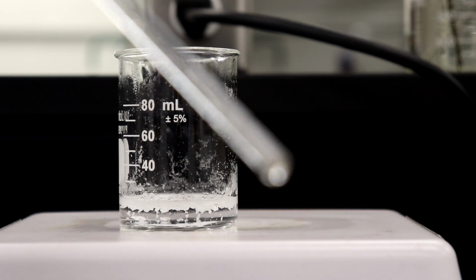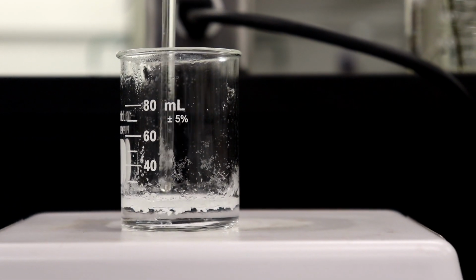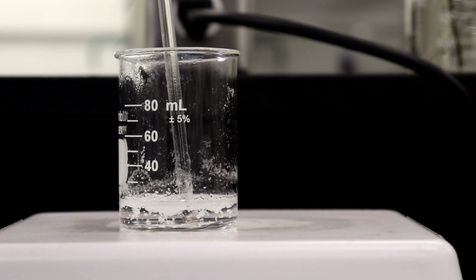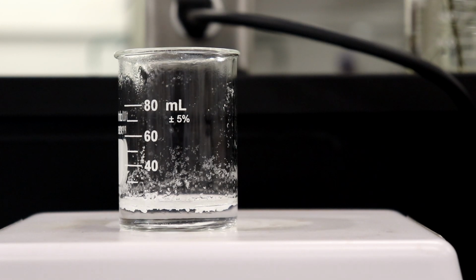And of course, the same issue as before is that you will get some crystals on your glass stir bar. The best thing to do is basically just wait until the solution is really hot and then dissolve them off in the solution after. I'm going to take the rest of the crude and put it back in the oven. So the crystals are indeed slowly going down. We're basically just going to wait until this water hits boiling. So we'll time lapse it.